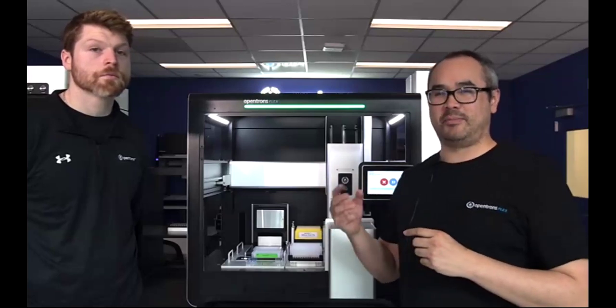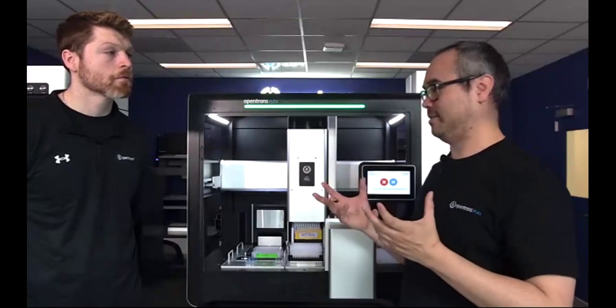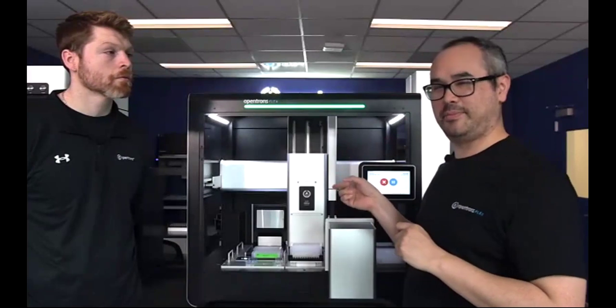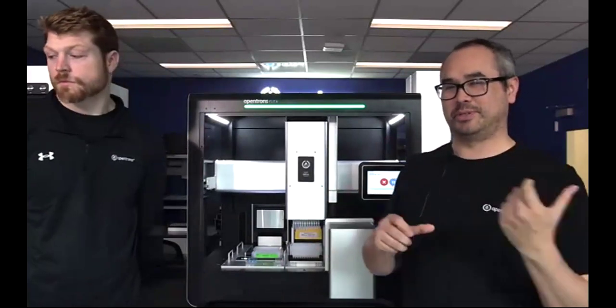The other thing is I have maybe 3 or 4 different reagent mixes, and I want to keep them all cold, all at 4 degrees. So I'm able to put all 4 of them on a single plate on the temp module just to keep them cool. So I don't have to do pauses. I don't have to swap anything out or pause it, run to my fridge and put something on there.